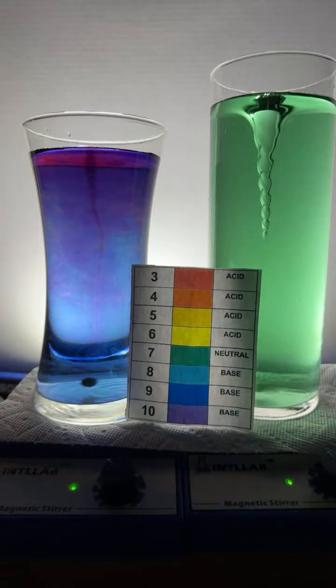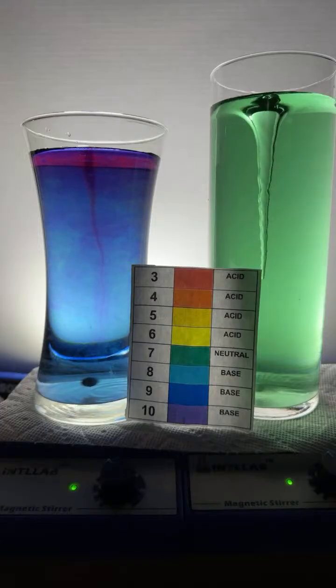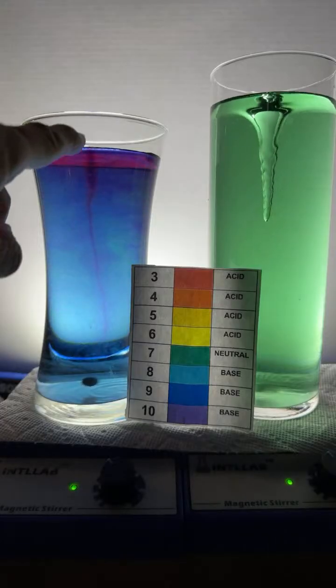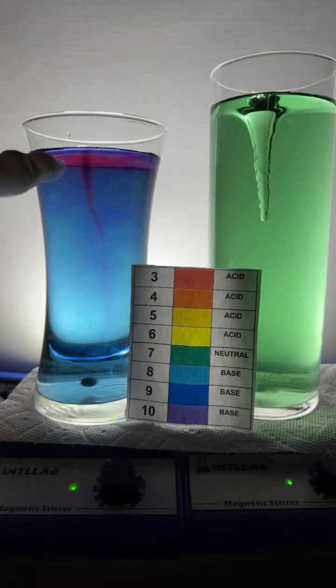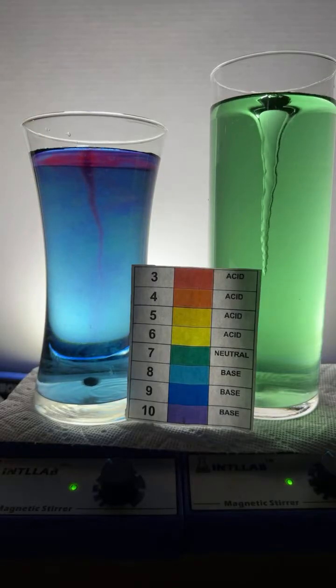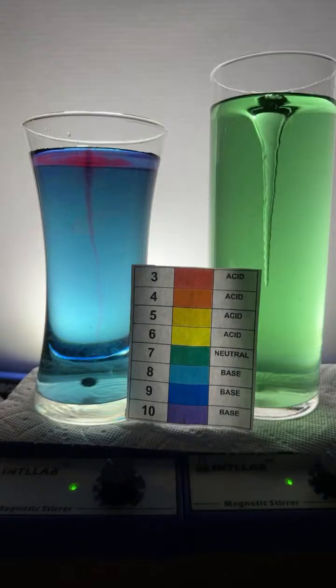Thank you there, Nova. When I touch the liquid inside, will something happen? Probably. Hey, look up here at the top. There's like a level of red up there. That is gorgeous. We're seeing some interesting effects going on for sure. Wow, there definitely is like a region of acidity right there at the top, which is really kind of cool.